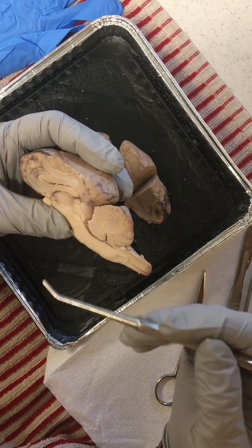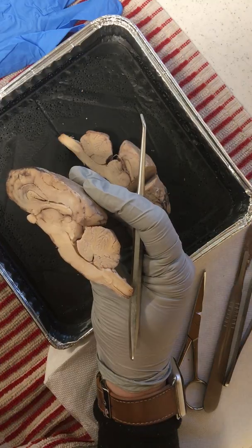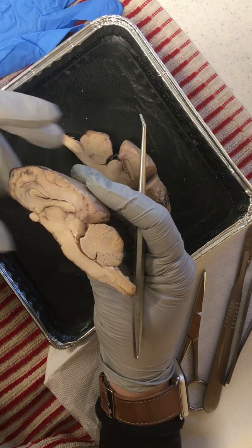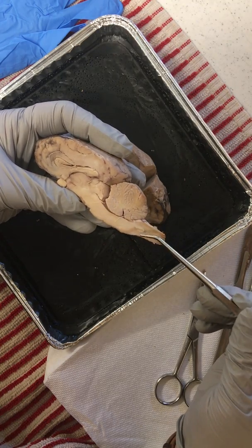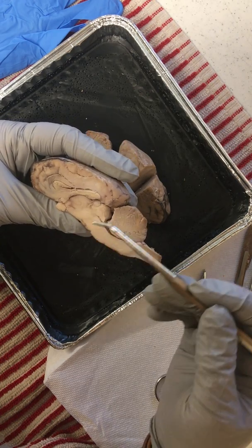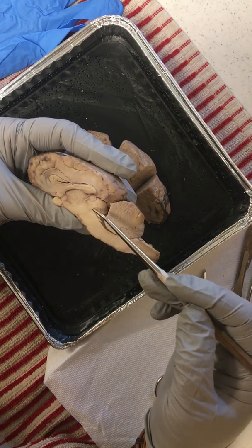So we have white matter, which is offset by the gray matter. That white matter is what gets the information moving and is made up of myelinated axons, whereas the gray matter is unmyelinated axons, cell bodies, dendrites, and synaptic terminals, and that is responsible for connecting that information. Again, as we go up through here, as part of the brain stem, we have the medulla oblongata, the pons. We ultimately reach the thalamus, which is the relay system. All of our information goes through that main center and is then sent out to the appropriate cortex.